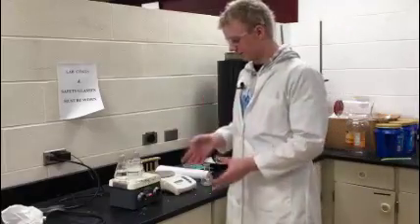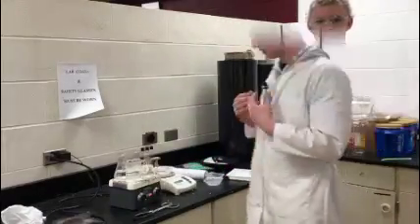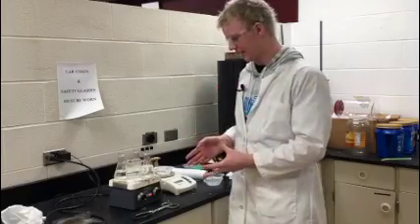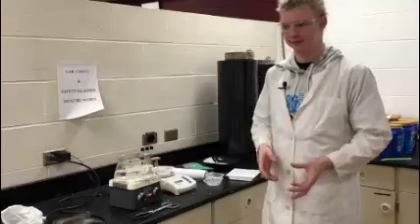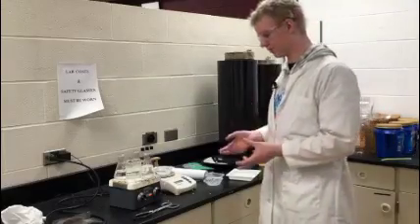You're going to be doing two tests: one on boiling water and one on room temperature water. We are going to go over boiling water now. You're going to need three samples, and each sample is going to be pellets that are 12 grams each.